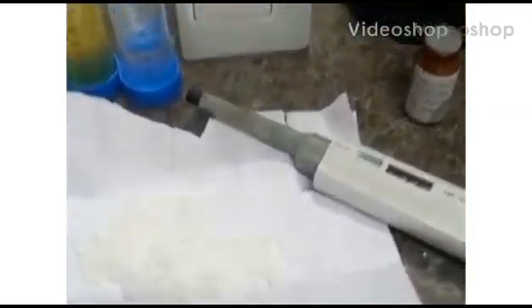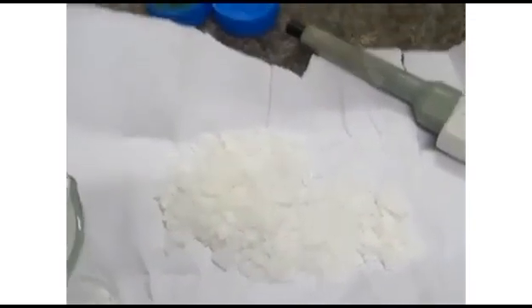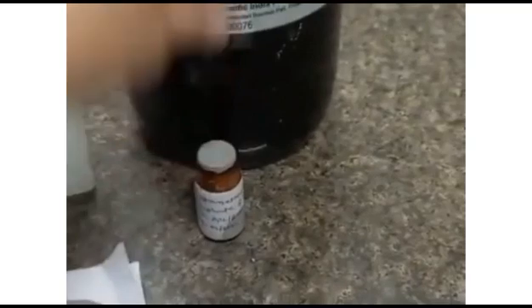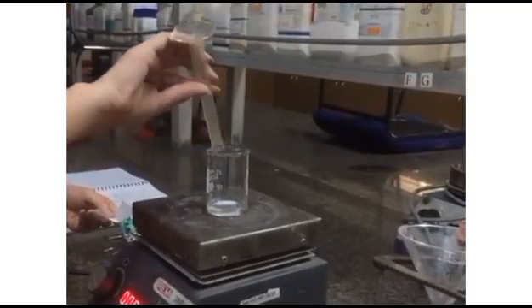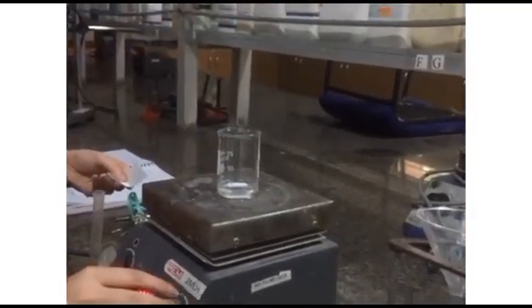For preparation of solid lipid nanoparticles, glyceryl monostearate was used as solid lipid. Tween 80 and PEG400 were used as surfactants, whereas ethanol and methanol were used as solvents. For the drug, we used betamethasone sodium phosphate, as it was prepared for the treatment of atopic dermatitis.